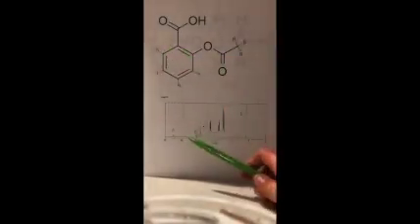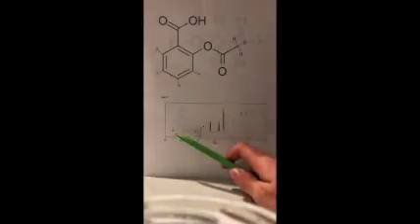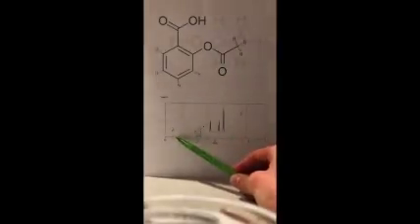Now, just looking at the spectrum, we'll start with A. So A corresponds to this hydrogen that's attached directly to the oxygen. We know that the closer a hydrogen is to an electronegative atom, the further downfield it's going to be. So obviously with this hydrogen being attached directly to the oxygen, it's going to be quite far downfield. So it corresponds to this signal over here.